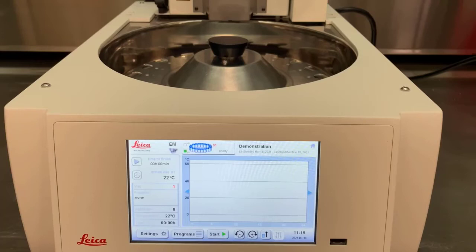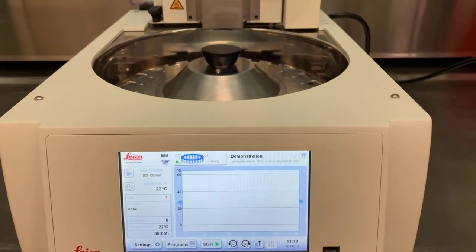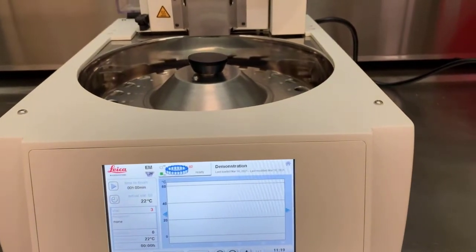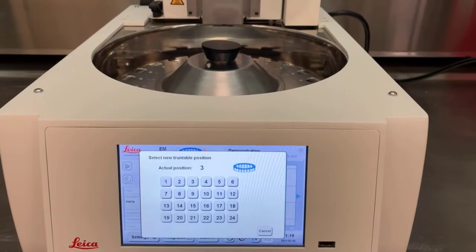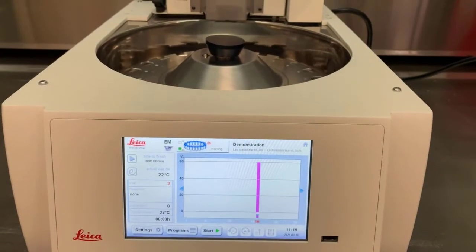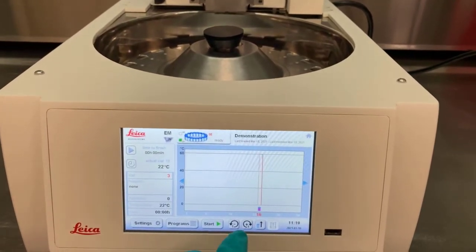The four small buttons on the right are the carousel and agitation controls. The two buttons with curved arrows allow advancement or backtracking of the carousel. While the vials can be selected one at a time, pressing and holding the button for advancement allows us selecting a particular turntable position. And then the carousel goes there. Pressing the back button and holding it will send the carousel back to the initial starting point.